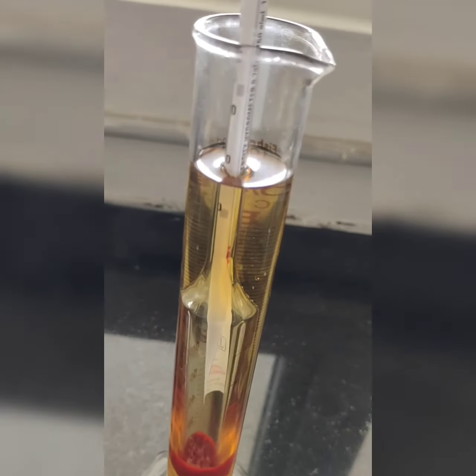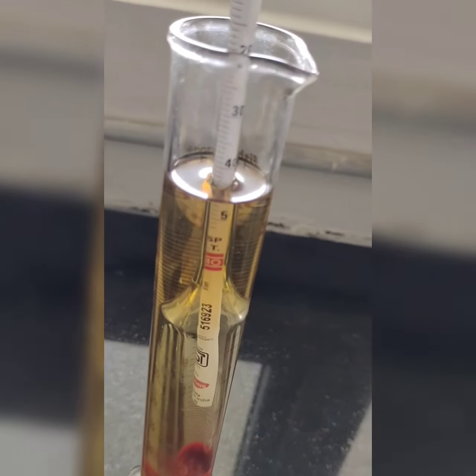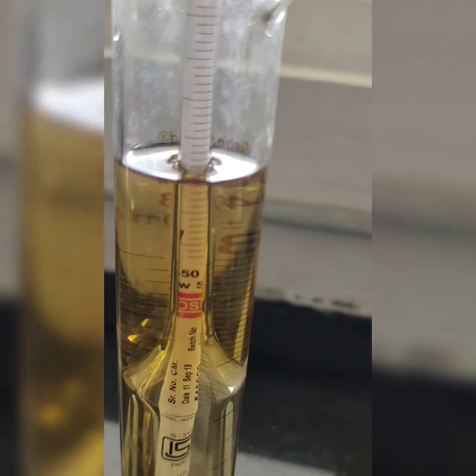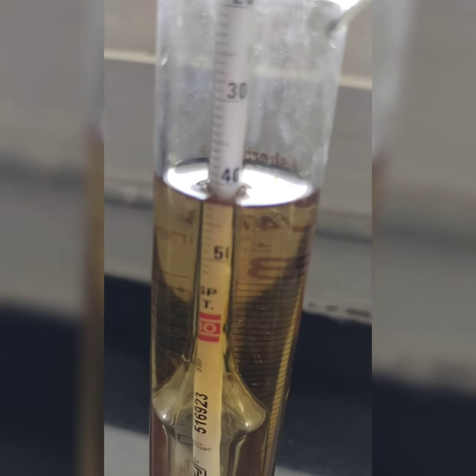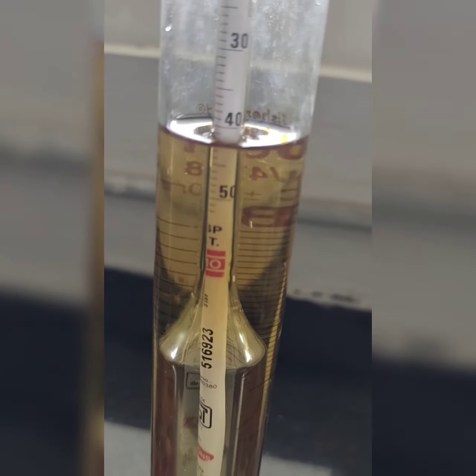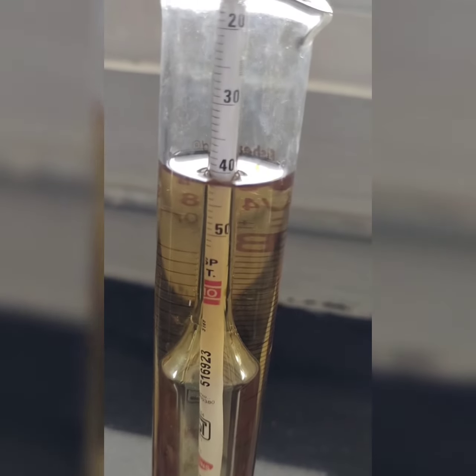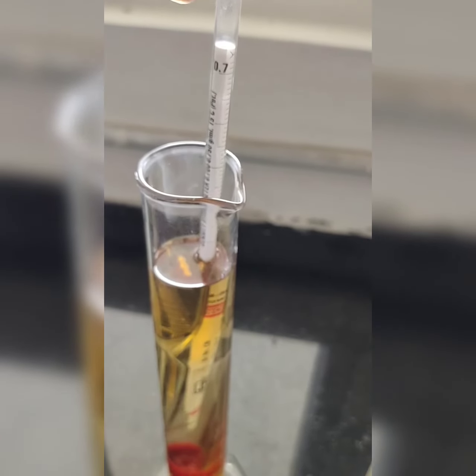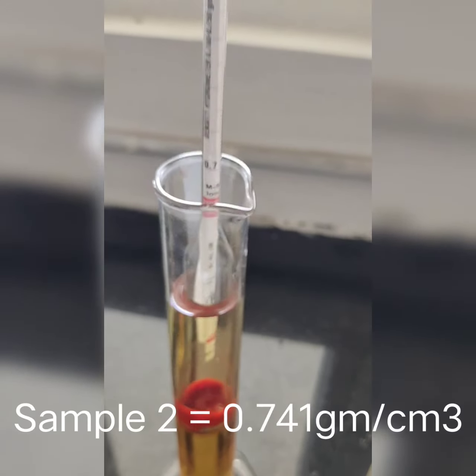Okay, so let's see this one's density. This one is lying near 41. Okay, so 41 of what? 0.7, 0.7.